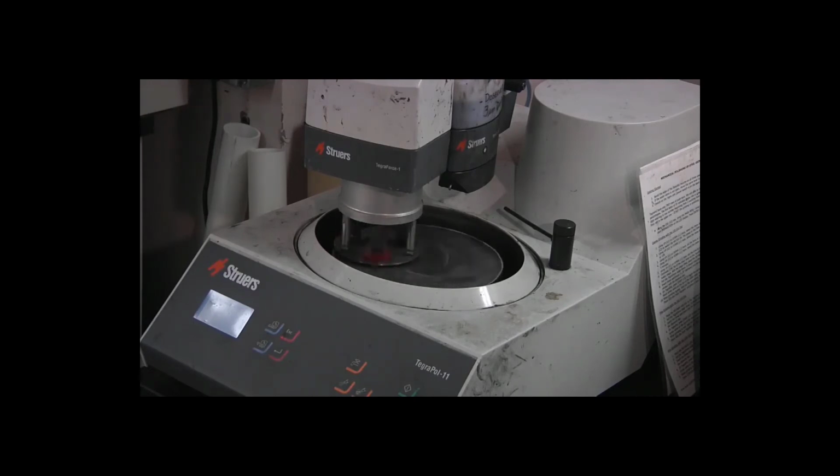But when you're done with the microscopic hardness test, you take the specimen out, you can't see the indents. They're so small you can't see them with the naked eye. If you tilt it around, sometimes you'll catch one of the edges, and it will catch the light and you'll see a little bright speck if it catches the light just right, but you still can't actually see the indent.